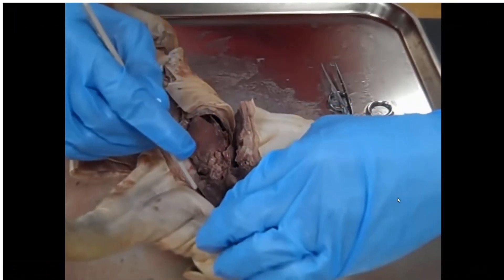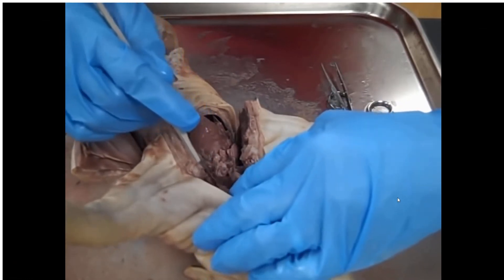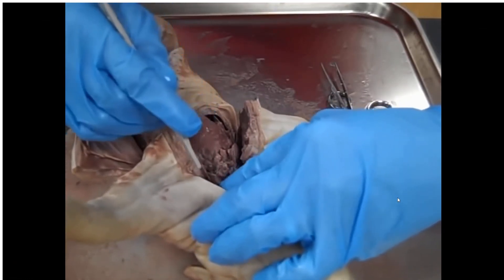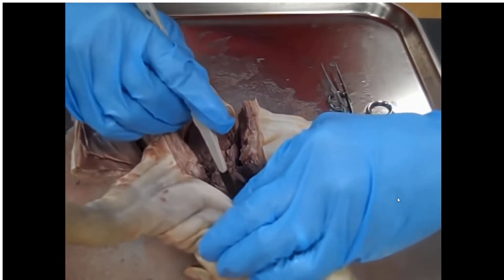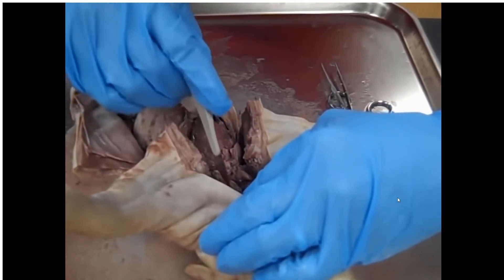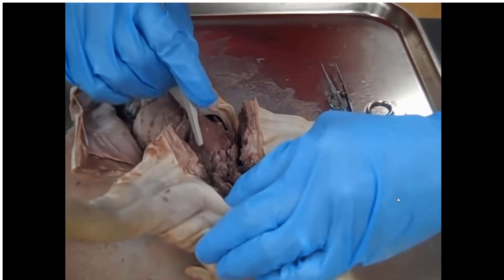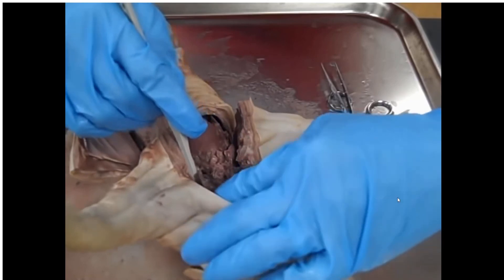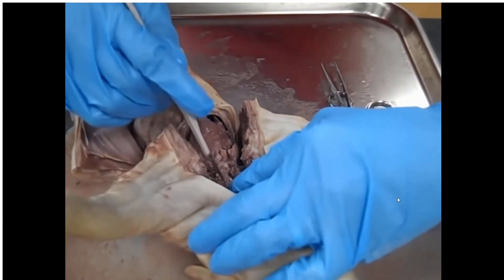So the trachea — if you look at it really closely, you can see that it's got cartilage rings. Keep that in mind for a minute from now, because we're going to chat about the differences between the trachea and the esophagus and their roles and what that means for their function.